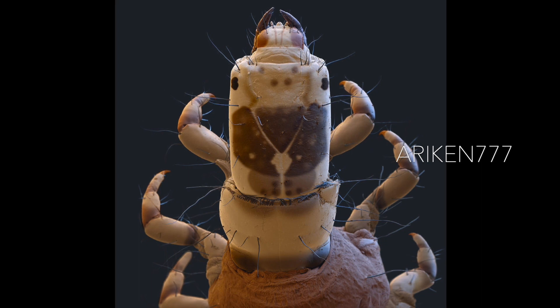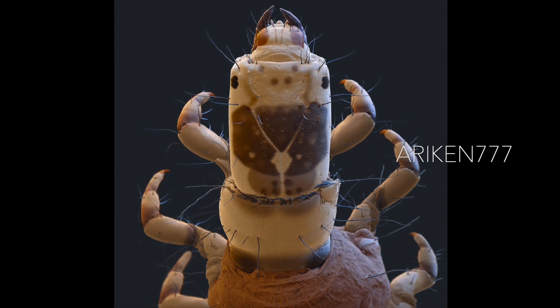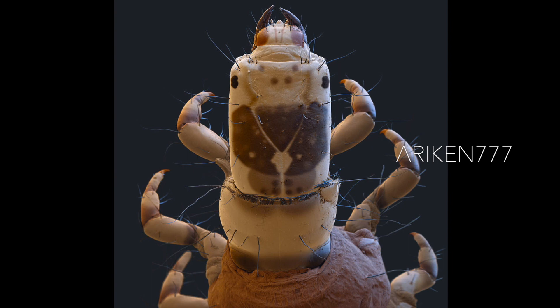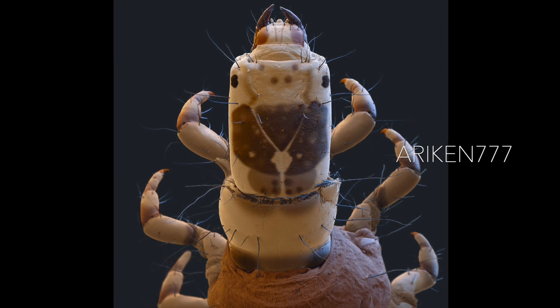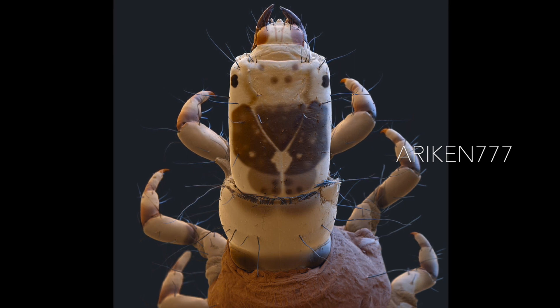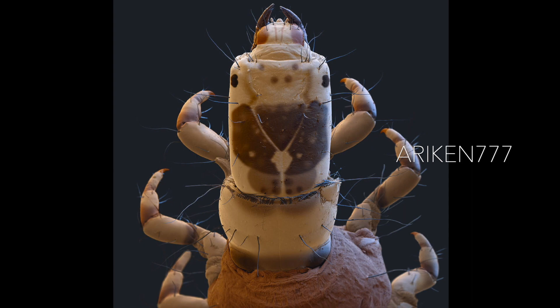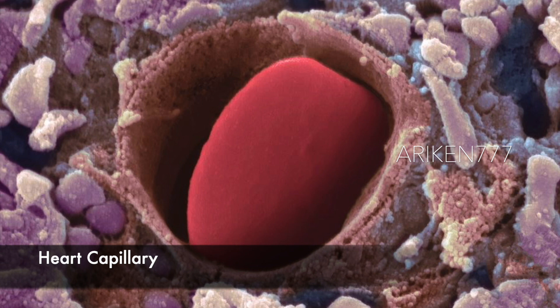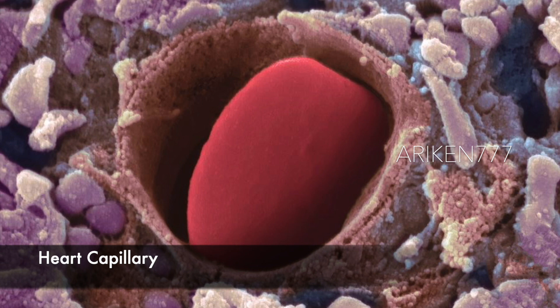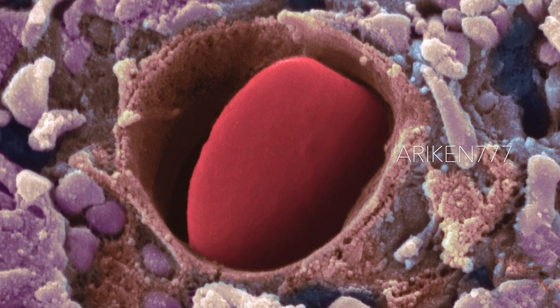At the end of their larval life, all of them spin a silk cocoon in which they carry out their pupal stage. This is a heart capillary with red blood cells between muscle fibers.